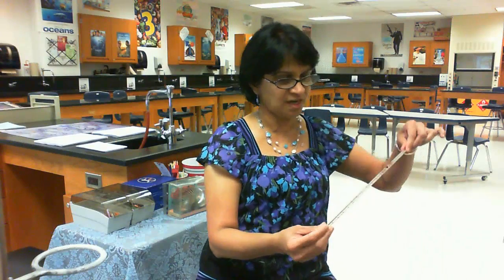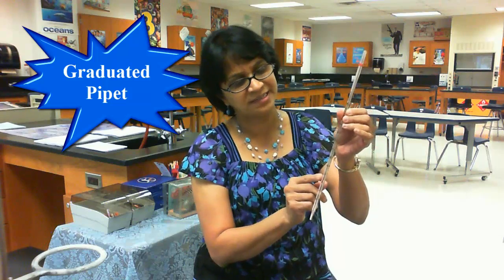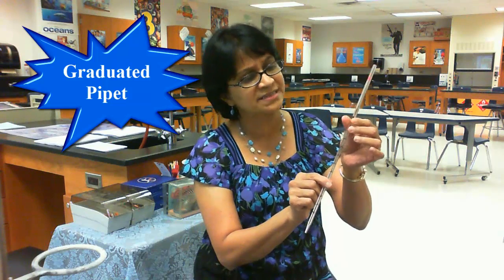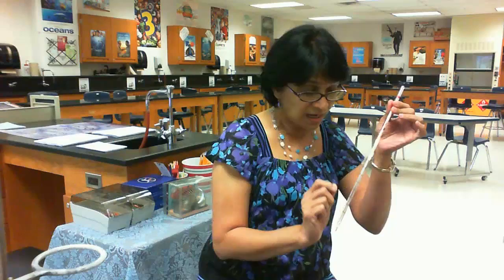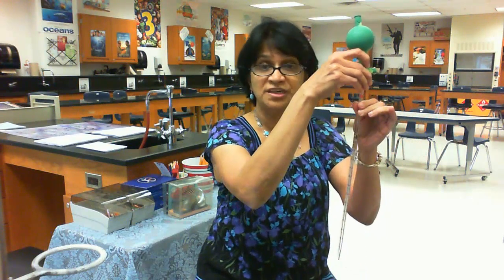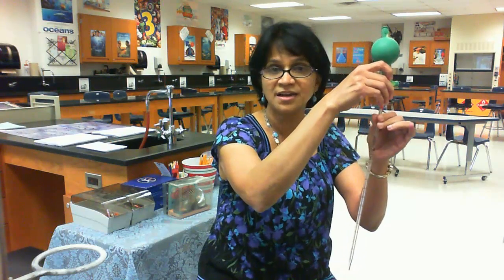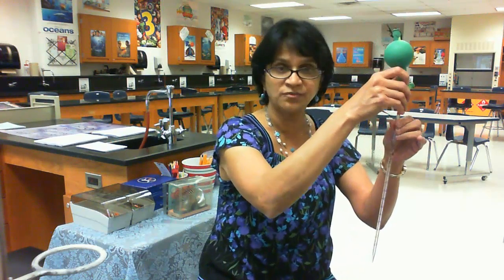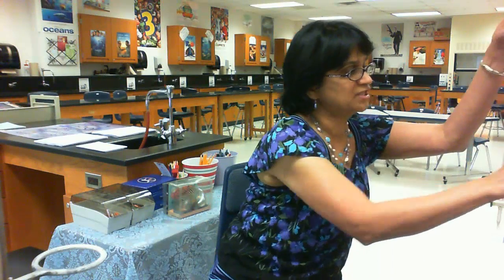Since we are talking about precise measurements, I'm going to talk about a pipette. A pipette is graduated — it has markings and these markings are very accurate. We can also use a pipette bulb to measure the exact quantity of liquid which we want to add.